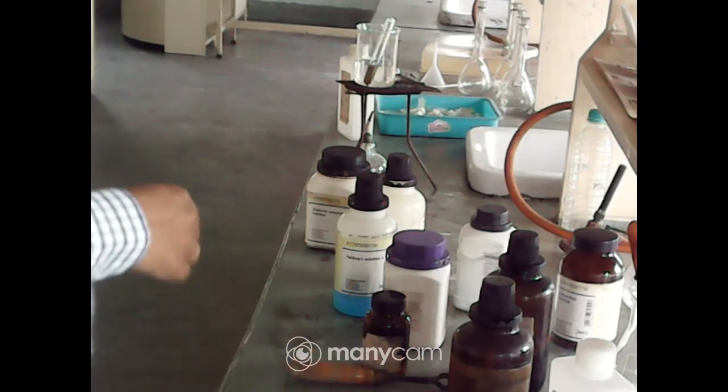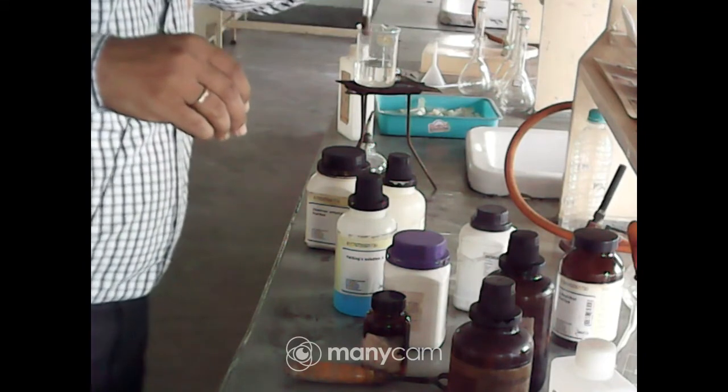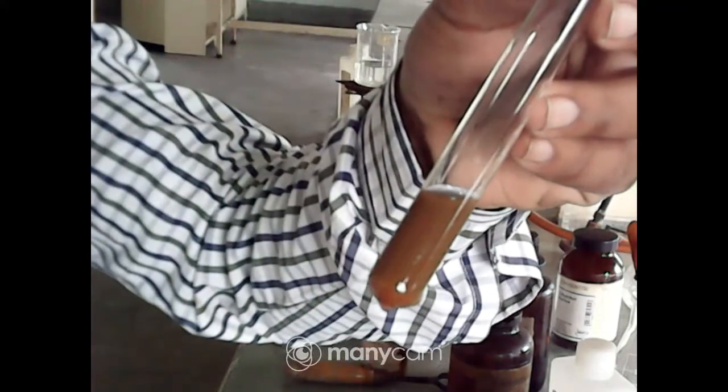Next we will perform the next test under protein. Okay, already it is transforming to the red color. You can see the red color transformation for the carbohydrate. So two tests we have performed under the carbohydrate section.